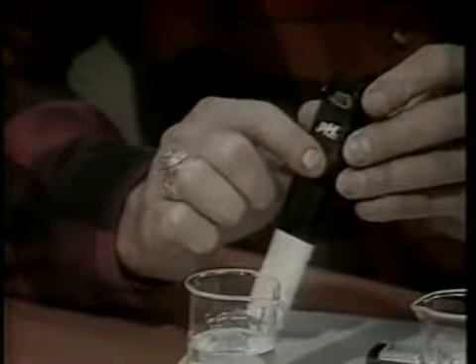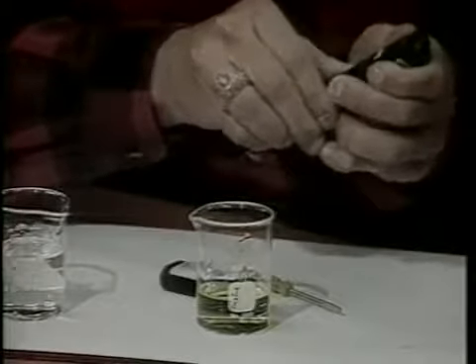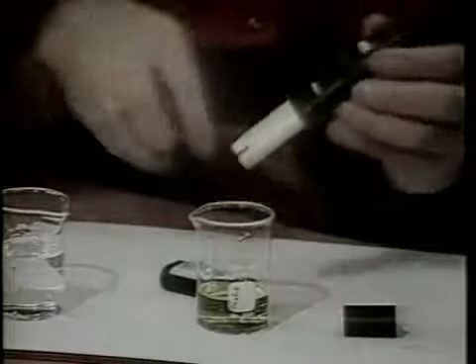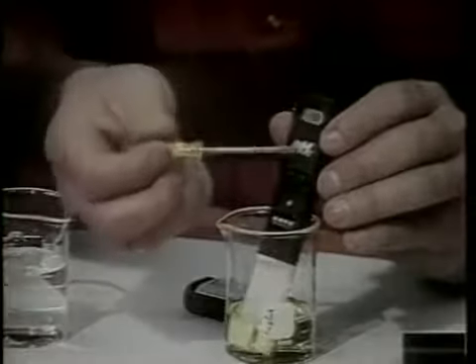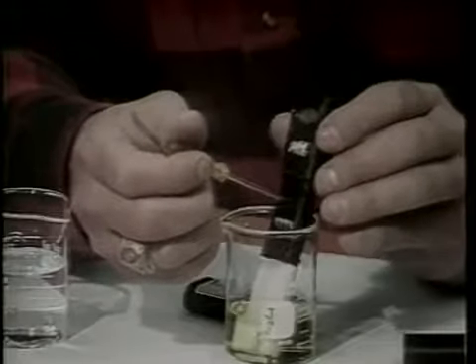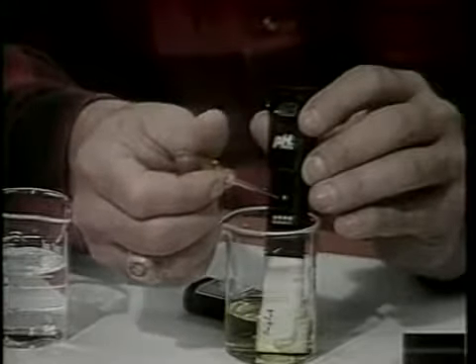To use this instrument, proceed as follows. Remove the plastic boot from the meter. Check the calibration of the meter by immersing the probe into a buffer of a known pH. The buffer should be within the normal pH range of the pond. Buffers may be purchased from scientific supply companies. To calibrate, adjust the calibration screw until the instrument reads the value of the buffer. Calibration should be done periodically, such as once every few days.